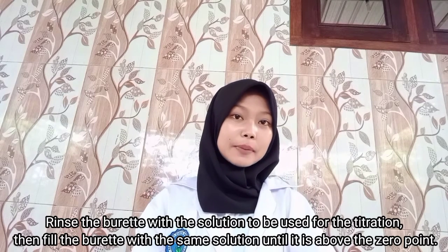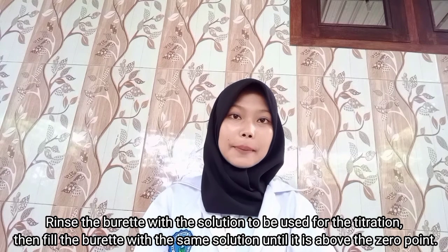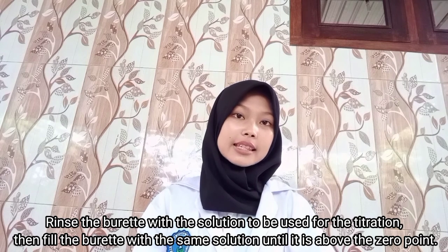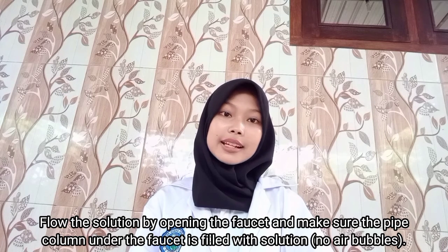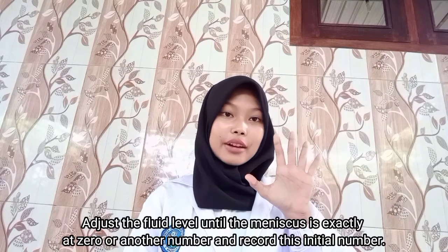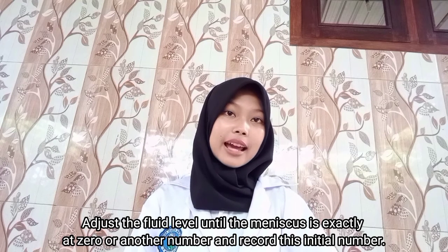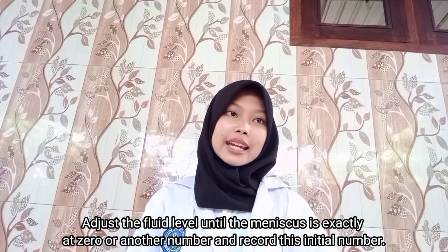3. Rinse the burette with the solution to be used for the titration, then fill the burette with the same solution until it is above the 0 point. 4. Flow the solution by opening the faucet and make sure the pipe column under the faucet is filled with solution. 5. Adjust the fluid level until the meniscus is exactly at 0 or another number and record this initial number.